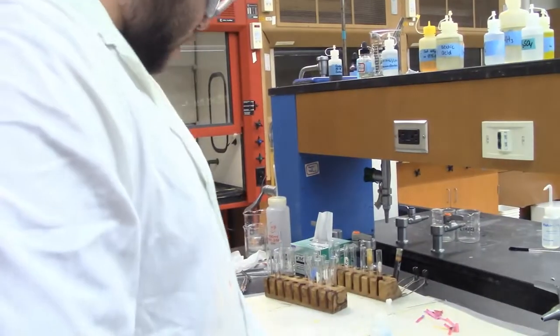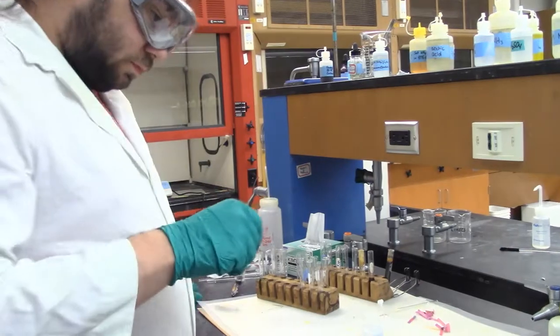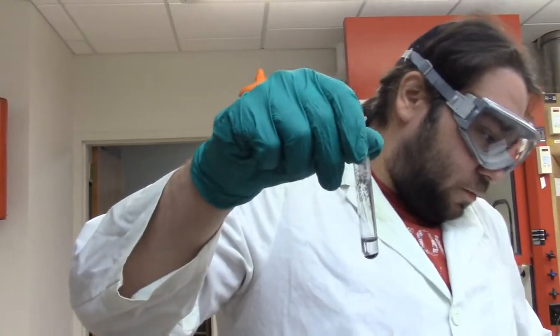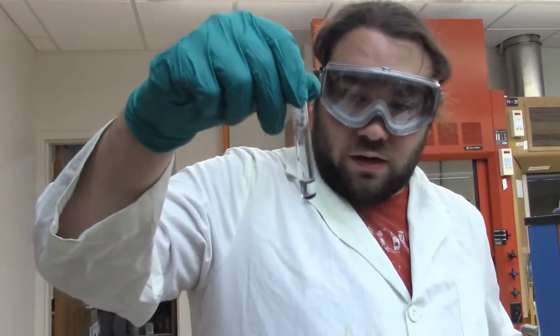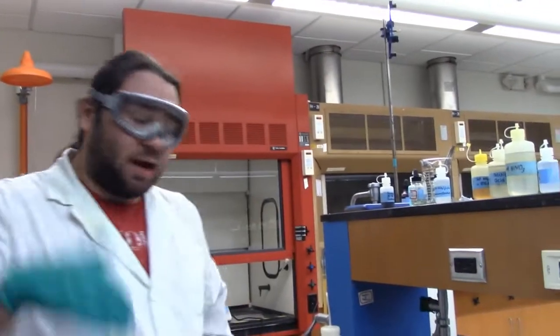So from there, we're going to take our precipitate with nickel and cobalt, and I'm going to give it another centrifuge just to be safe, even though it has all the same precipitate at the bottom, and we'll come back and do those tests in a minute. Alright, so I've gone ahead and done a couple of things off camera because you don't need to see them.